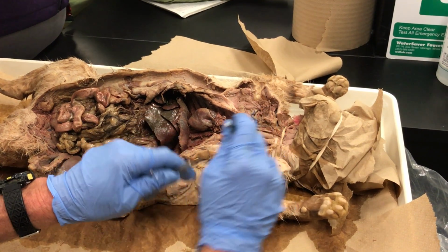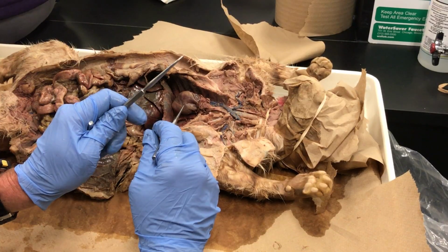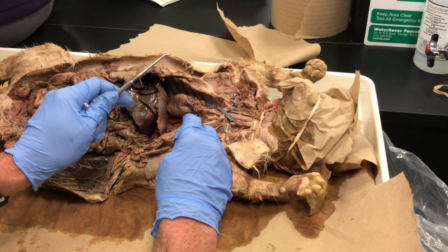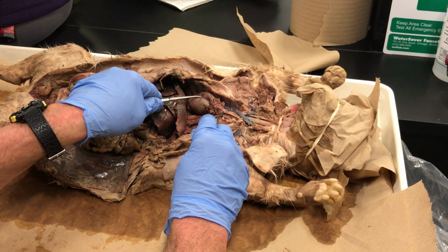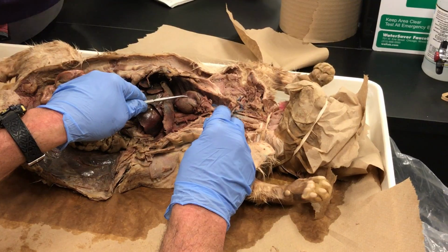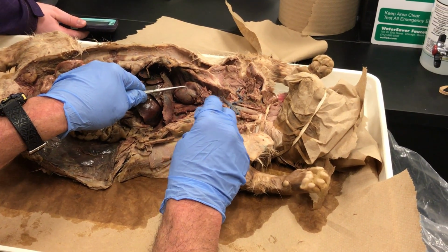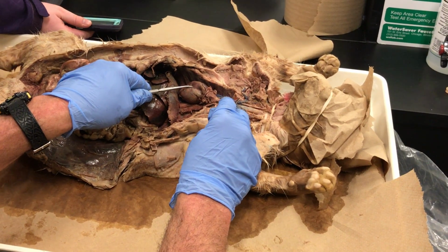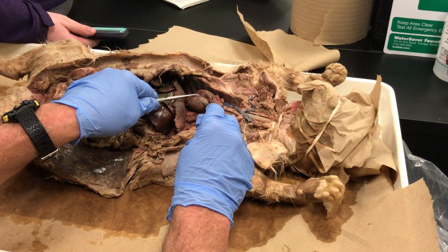Let's do the other major. Oh, go ahead. Sorry. So the subclavian comes off the aorta on one side and off of the brachiocephalic on the other. And on our body, it comes off of the aorta on one side, just like it does on the cat. The subclavian would come off of the brachiocephalic on a human as well. Our brachiocephalic, when it comes up, has the right common carotid and the subclavian, because the other common carotid comes off the aorta all by itself.